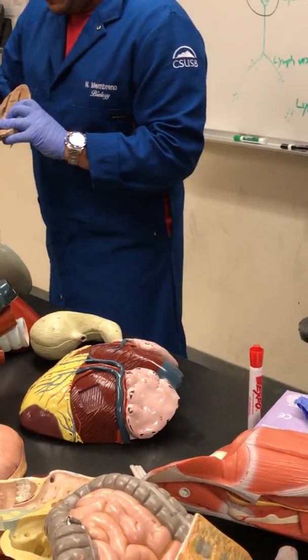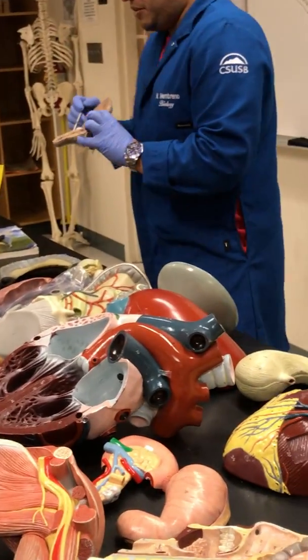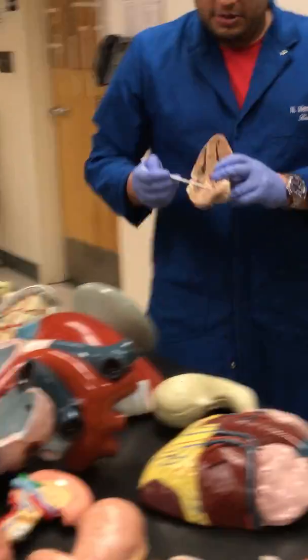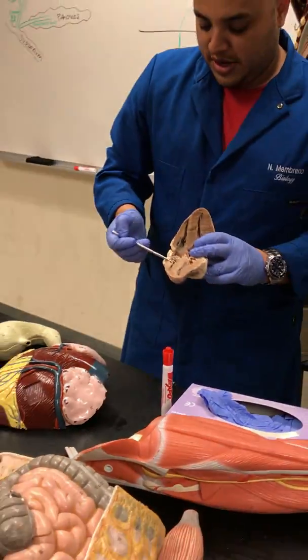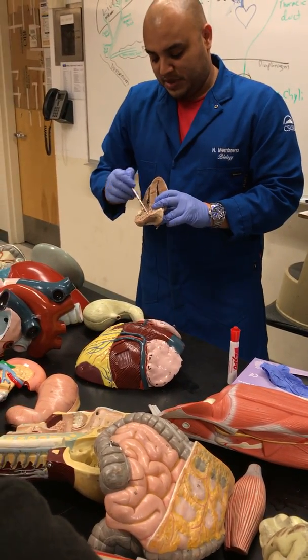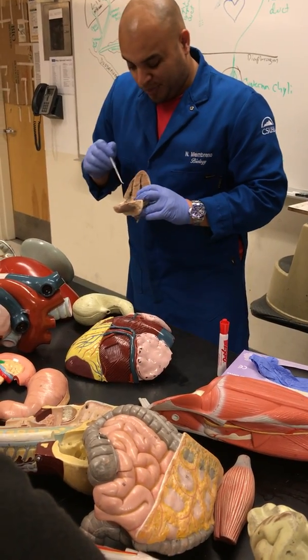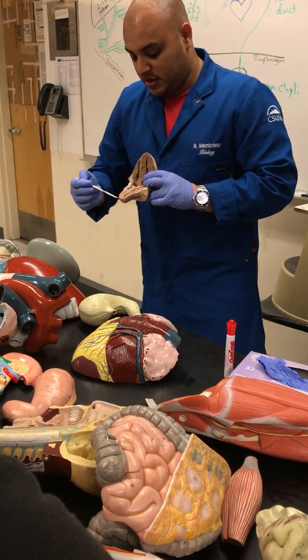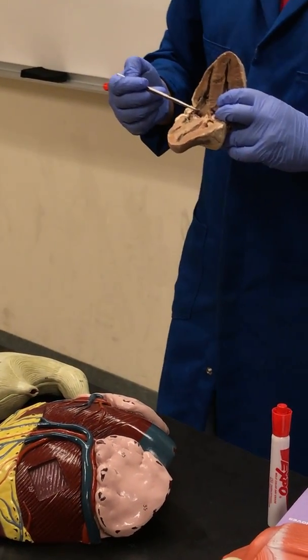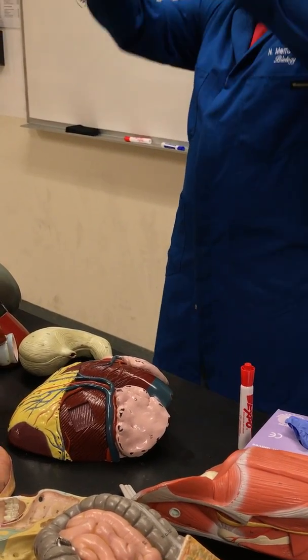So what valve is this here then? This is the tricuspid valve. You want to try to be right, even on the exam, right? This is the bicuspid valve. See, tricuspid or bicuspid. I prefer the bicuspid instead of mitral. Bicuspid, tricuspid, right? This thing here is called the interventricular septum. It separates the right ventricle from the left ventricle.